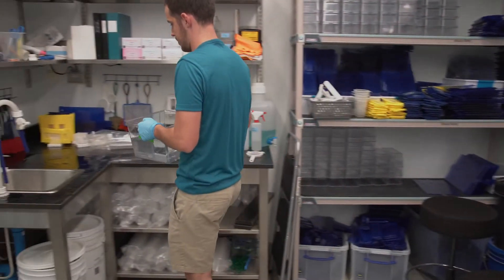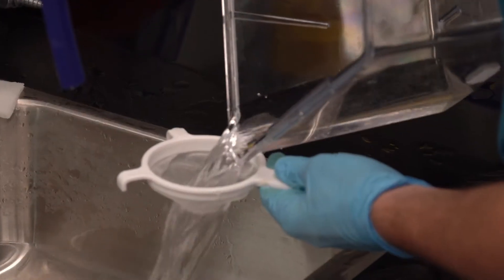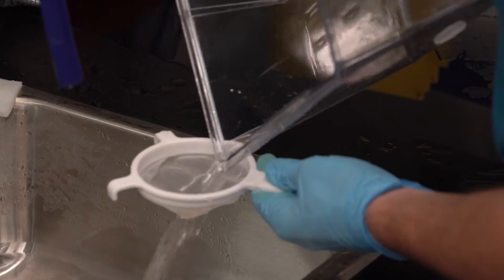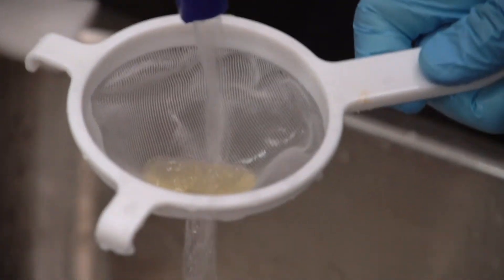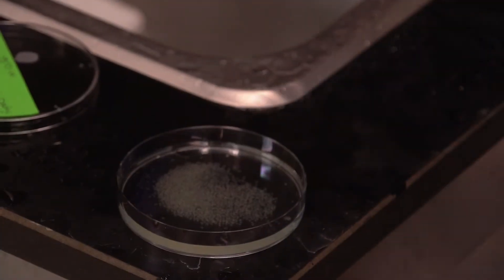A lot of the work that we do is in their offspring, in their larvae, and these are transparent. So it's very easy for us to be able to see them under the microscope, being able to label cells or label genes with fluorescent markers.